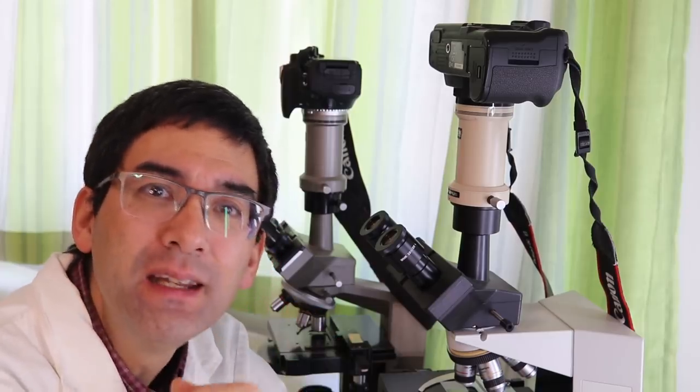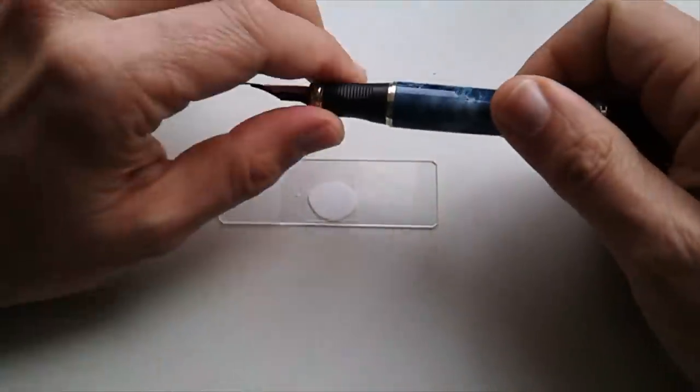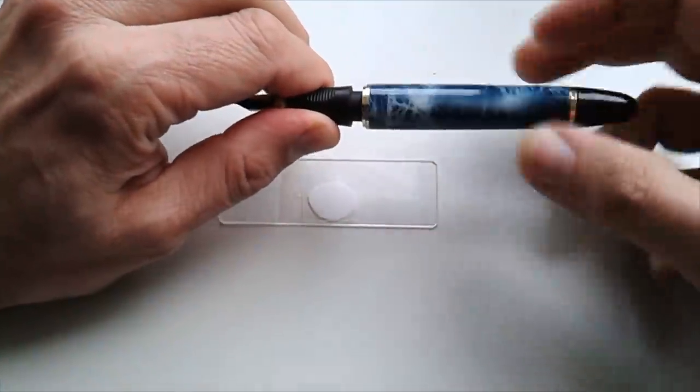Well, it was all very nice, but I don't know, the foam collapsing is a little bit too slow for me. I want to see a little bit more action. So what I want to do now is add some blue ink. Maybe I can see a little bit how the ink and the foam interact with each other. I've never tried this before, so I'll give it a try.